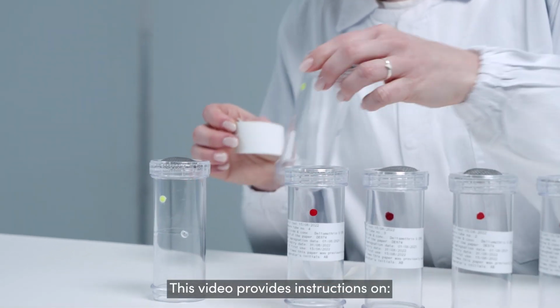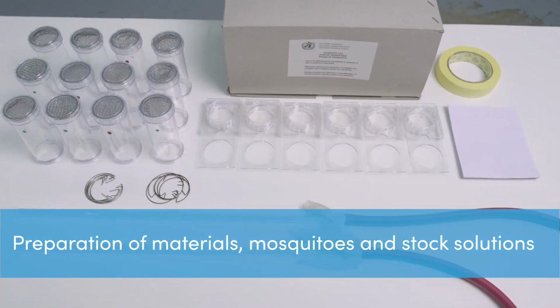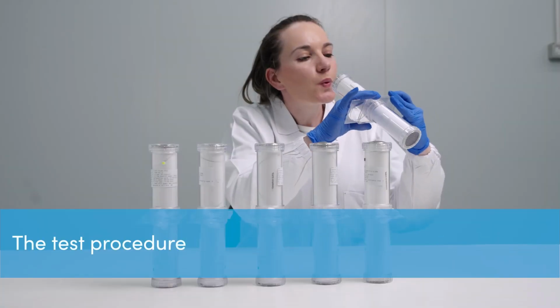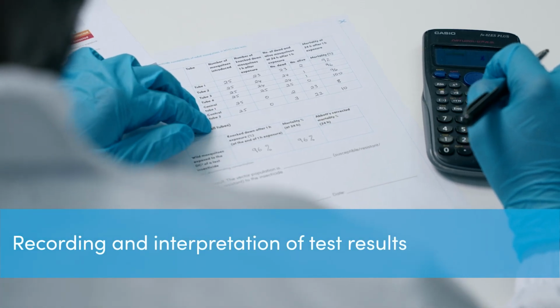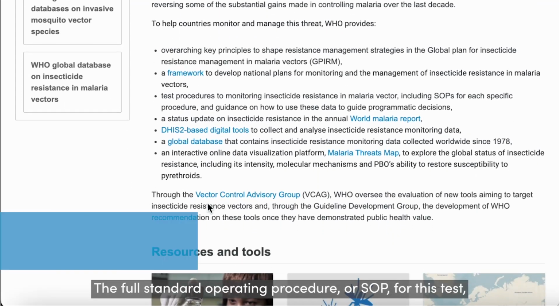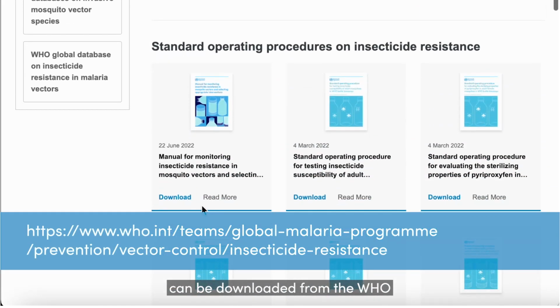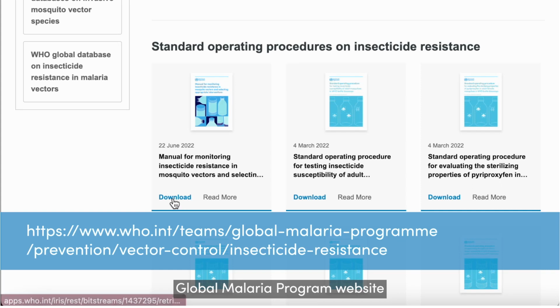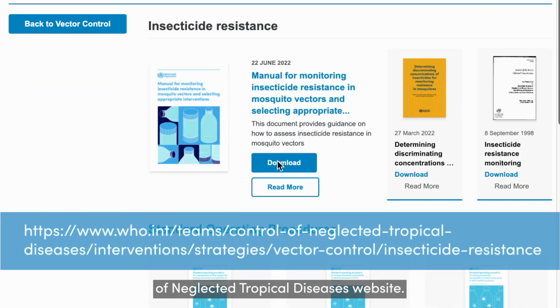This video provides instructions on the preparation of materials, mosquitoes and stock solutions, the test procedure, and the recording and interpretation of test results. The full Standard Operating Procedure, or SOP, for this test can be downloaded from the WHO Global Malaria Program website and the Department of Control of Neglected Tropical Diseases website.